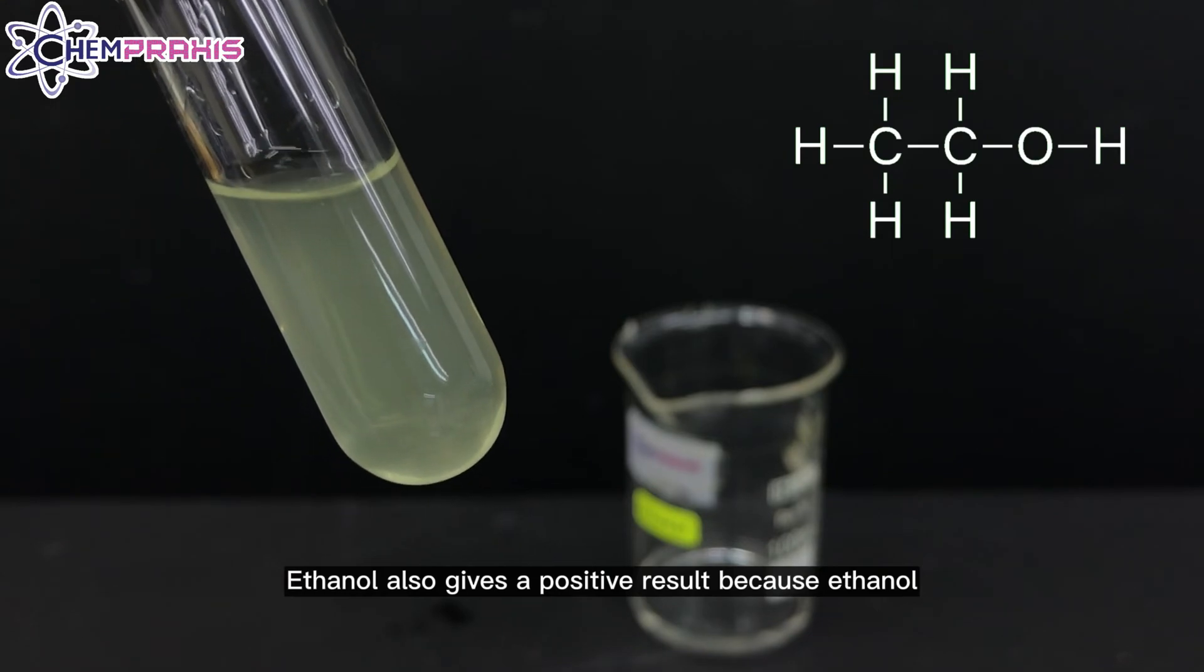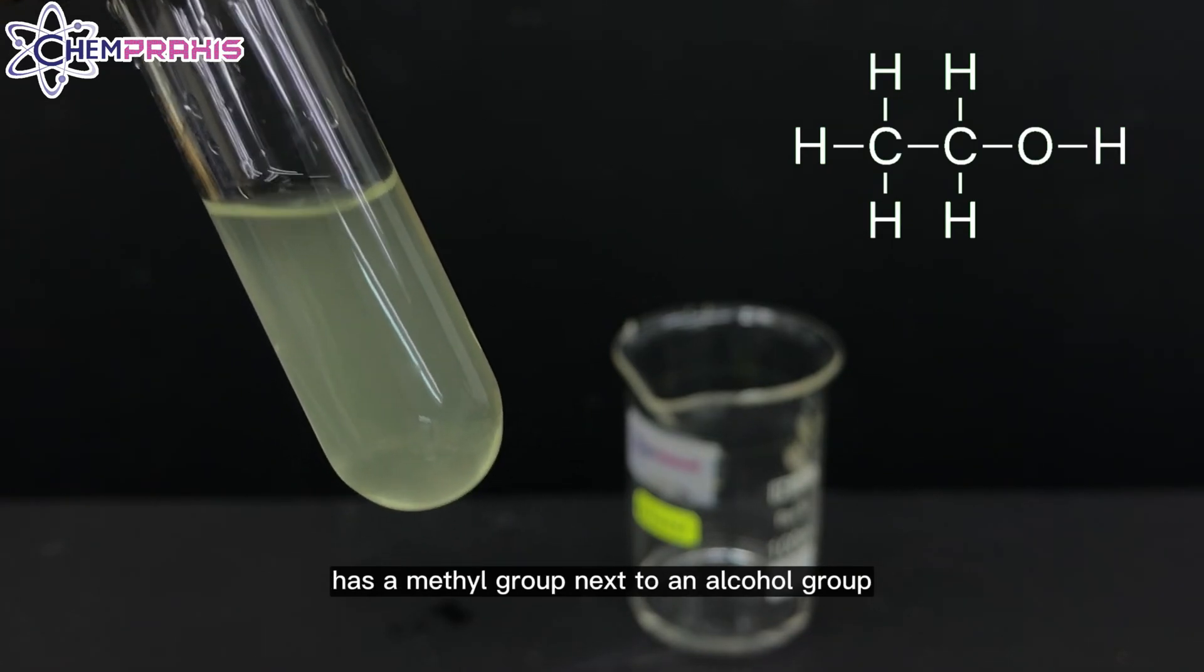Ethanol also gives a positive result because ethanol has a methyl group next to an alcohol group.